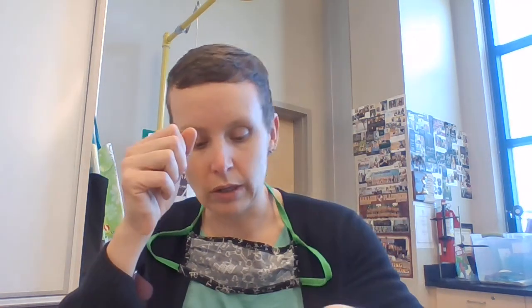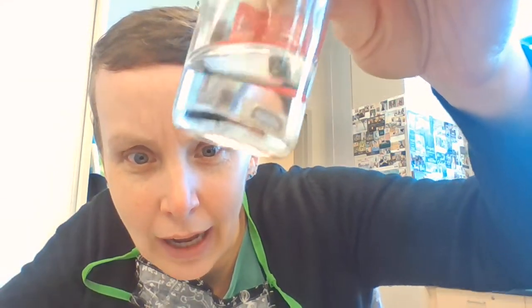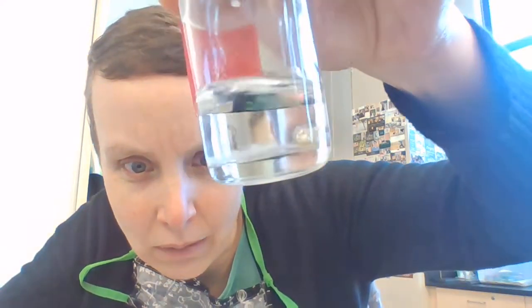There are also some little white flaky things in the oil because, like I said, every time that little chunk gets exposed to air, even the air inside the bottle, it's going to react with whatever water is there. And you're going to end up with these little flakes of sodium oxide, sodium hydroxide, kind of floating around in the oil. So what you really, I'm going to try and get it up here. You really want to look at that cube of metal. Okay.